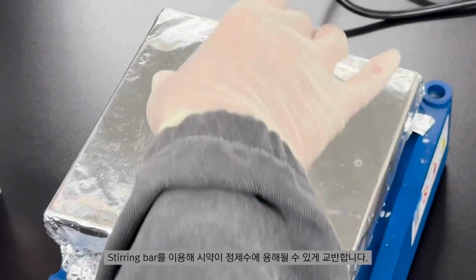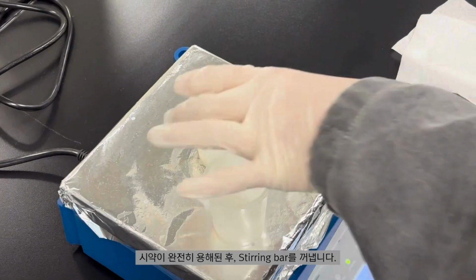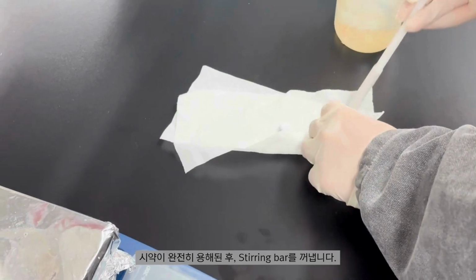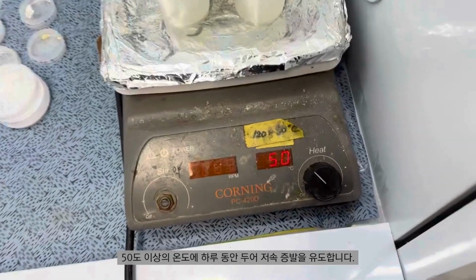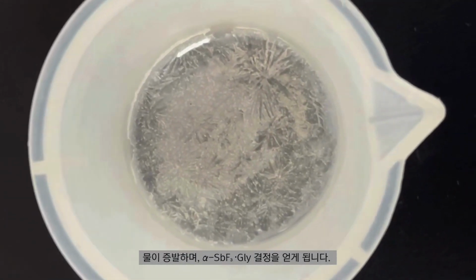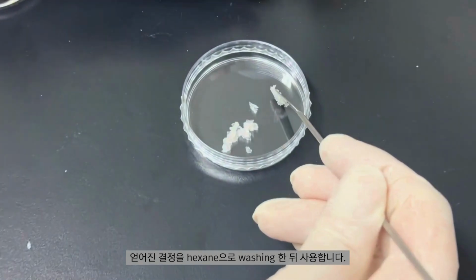Using a stirring bar, ensure that the reagents dissolve completely in the distilled water. Once the reagents are fully dissolved, we remove the stirring bar. The solution is then left at a temperature above 50 degrees Celsius for 1 day to induce slow evaporation. As the water evaporates, we get alpha antimony fluoride glycine crystals. Use the crystals after washing with hexane.